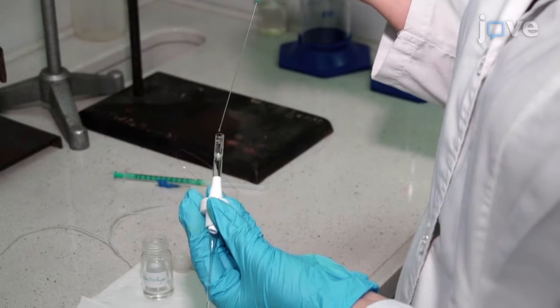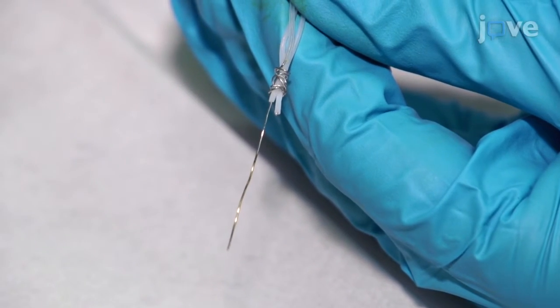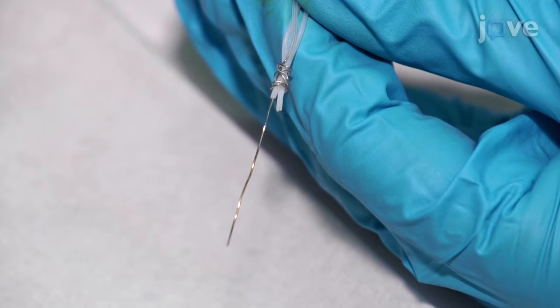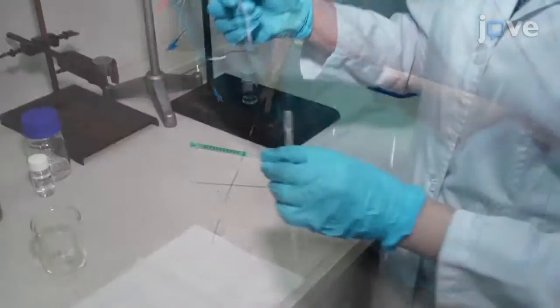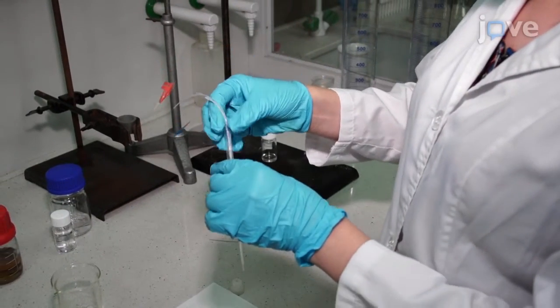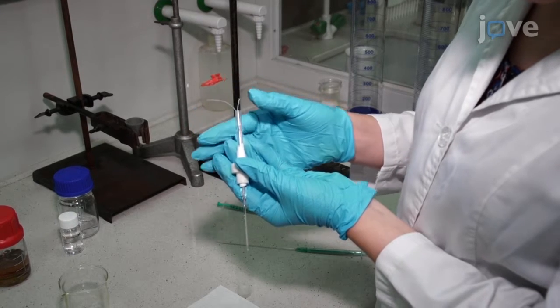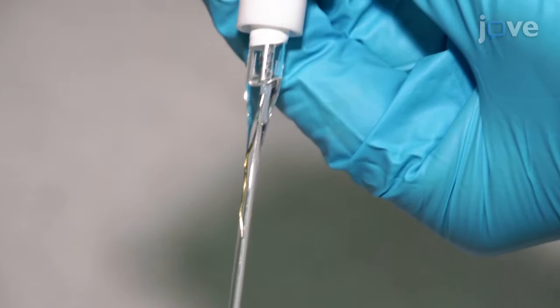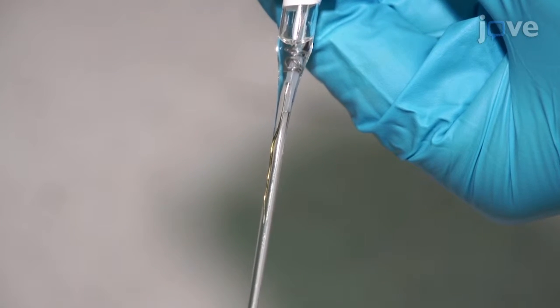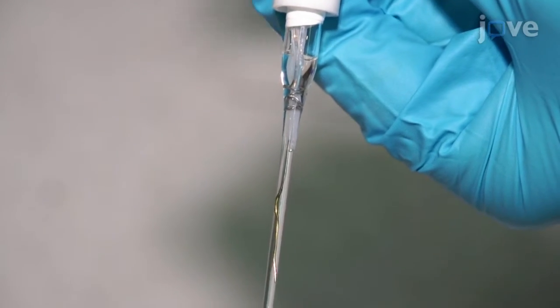Next, refill the cell with the electrolyte. Place the electrodes in the cell with the reference and working electrodes inside the auxiliary electrode wire spiral, being careful not to damage the polymeric layer on the working electrode. Position the working electrode close to the bottom of the cell and the reference electrode near the upper part of the active section of the working electrode.